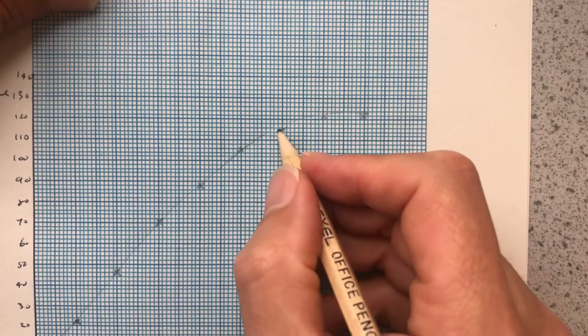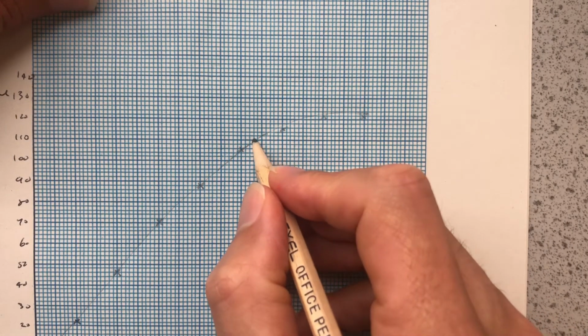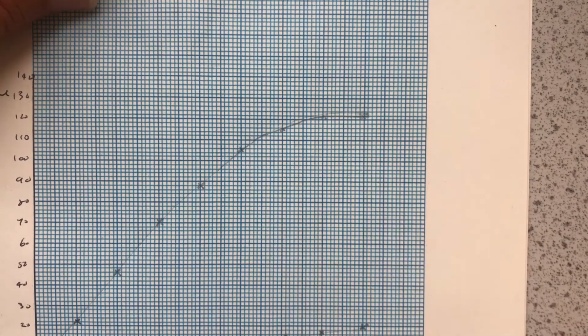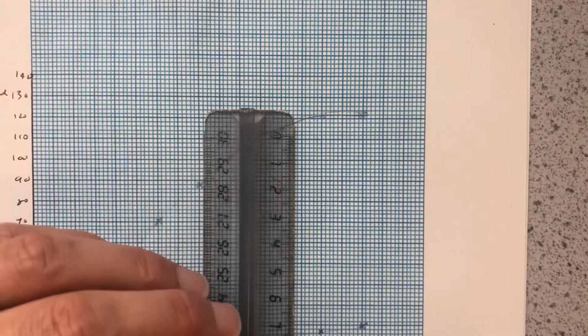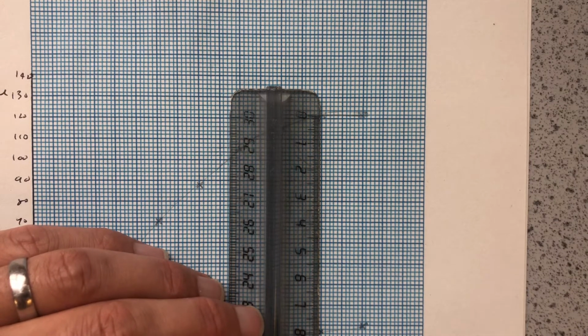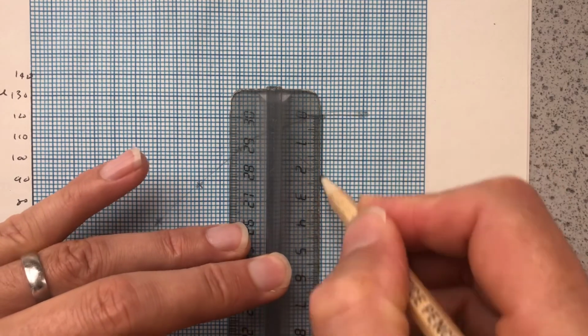So we can have a go at it. If we make a slight mistake, we can have a go at improving it. The aim is to flatten that out there. So I'm happy with that. Now that experiment has, where the curve goes flat, where no more gas is given, that tells us the reaction has finished. So I'm going to rule down from there at this point.